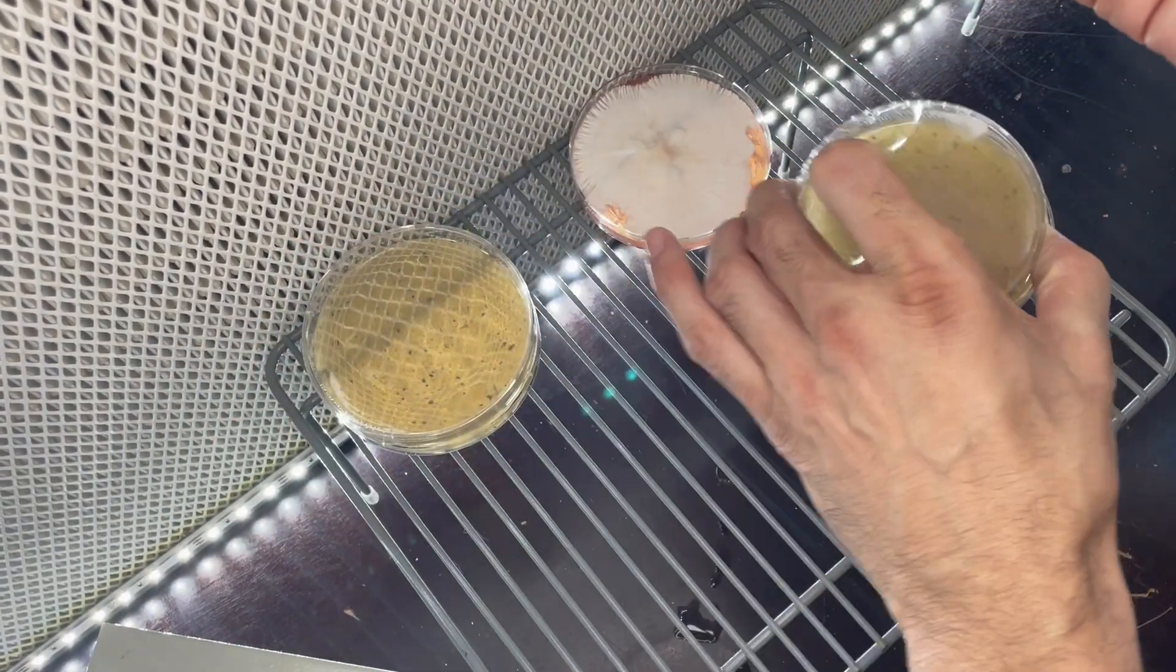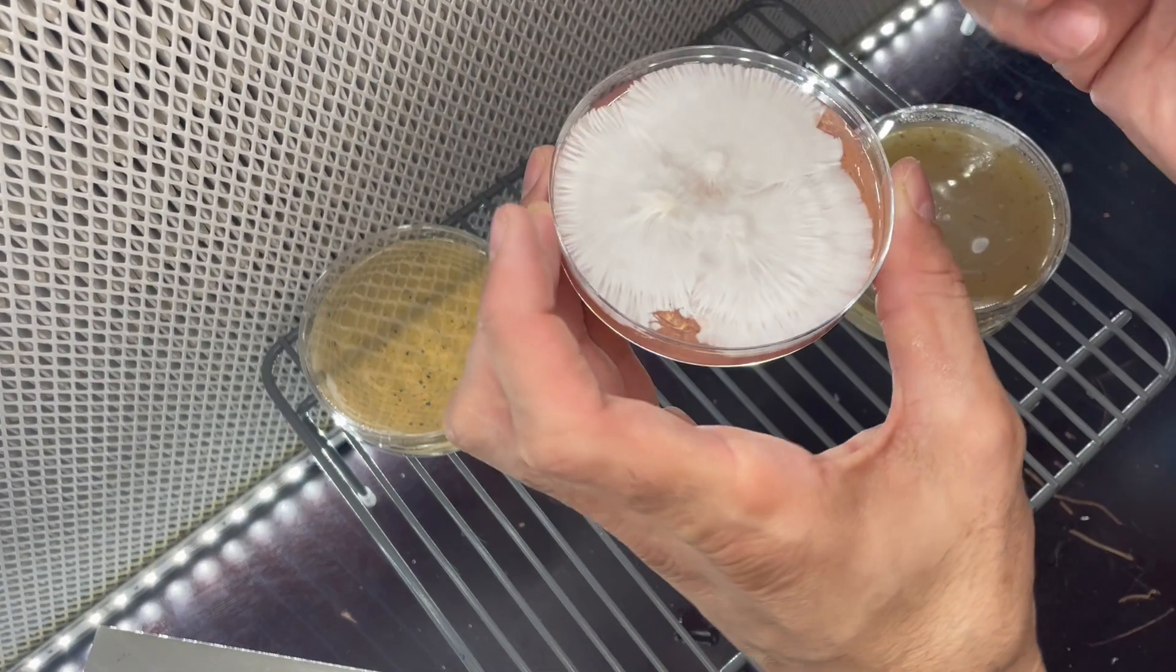Someone's giving me a little hard time. There it is. Sometimes they don't want to come off the dish and that's okay.